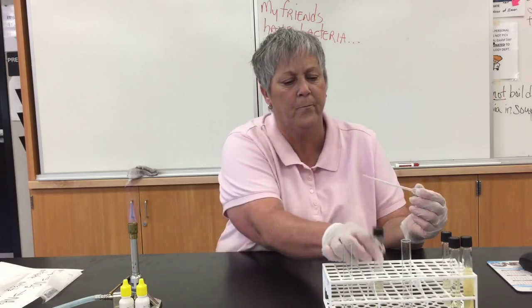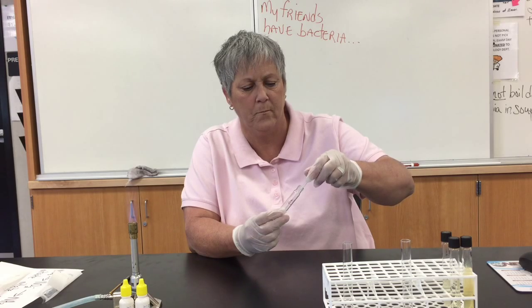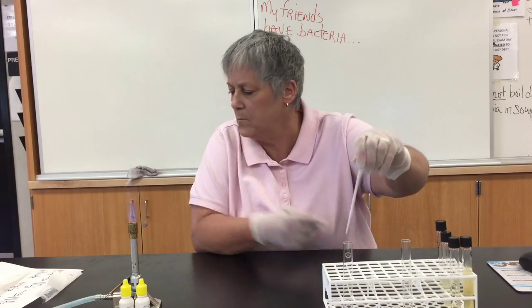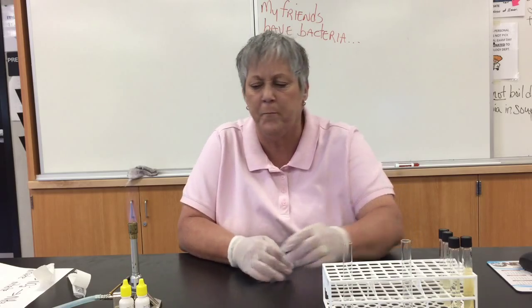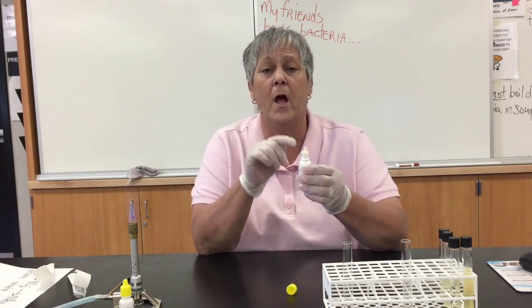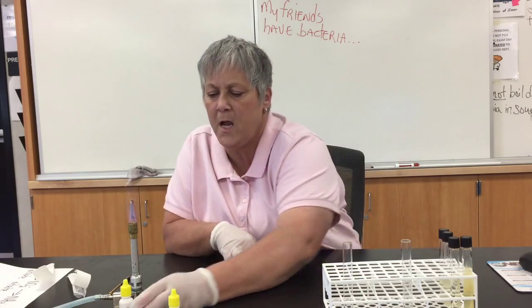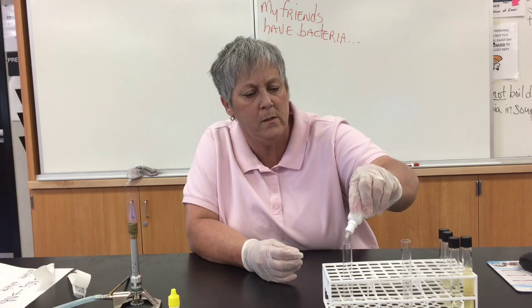I'll do the same with Acinetobacter. Then I'm going to add my reagents. We use for this test nitrate reagent A and reagent B. I'm going to place three drops of each of those reagents into each of my test organisms, taking care not to touch the tip of the bottle to the tube. Three drops of reagent A — one, two, three — into each tube. Then three drops of reagent B — one, two, three — into each tube.